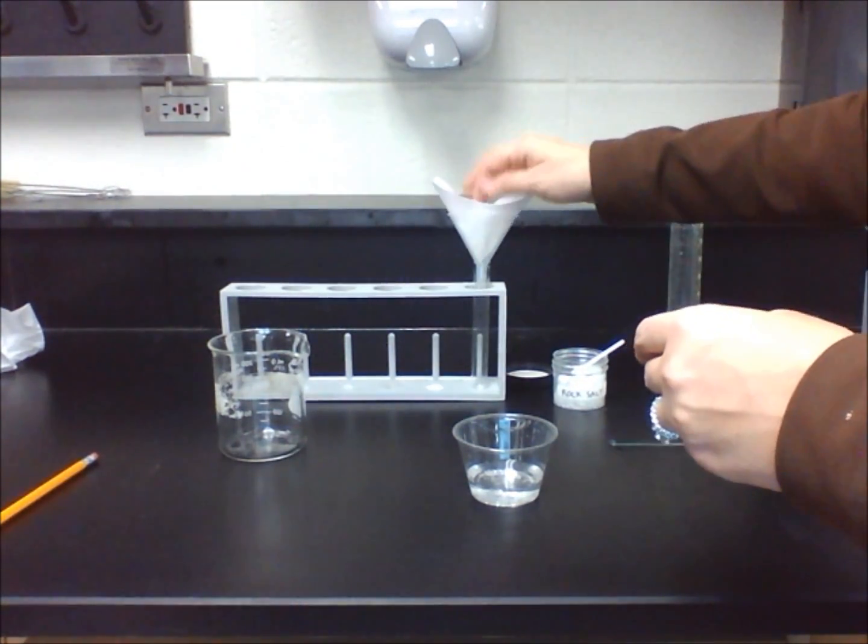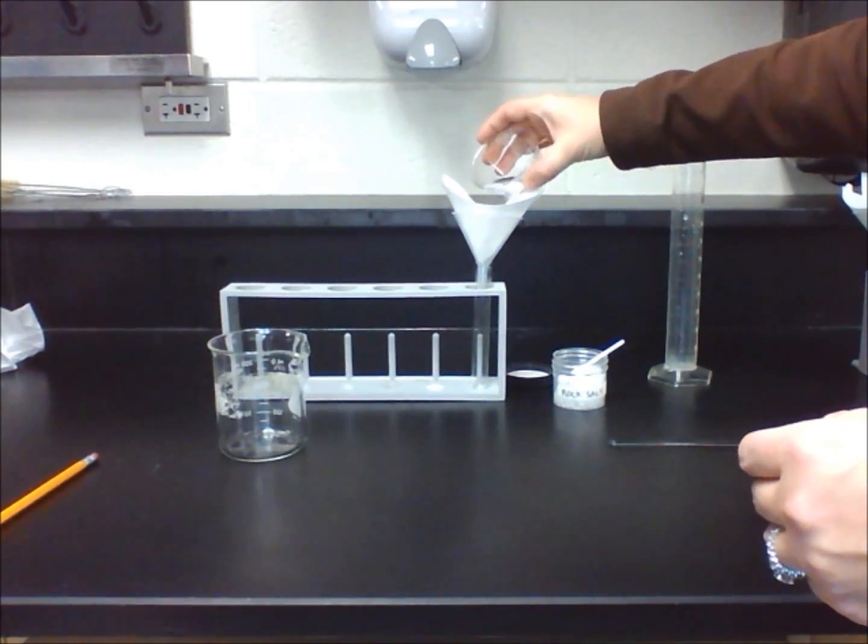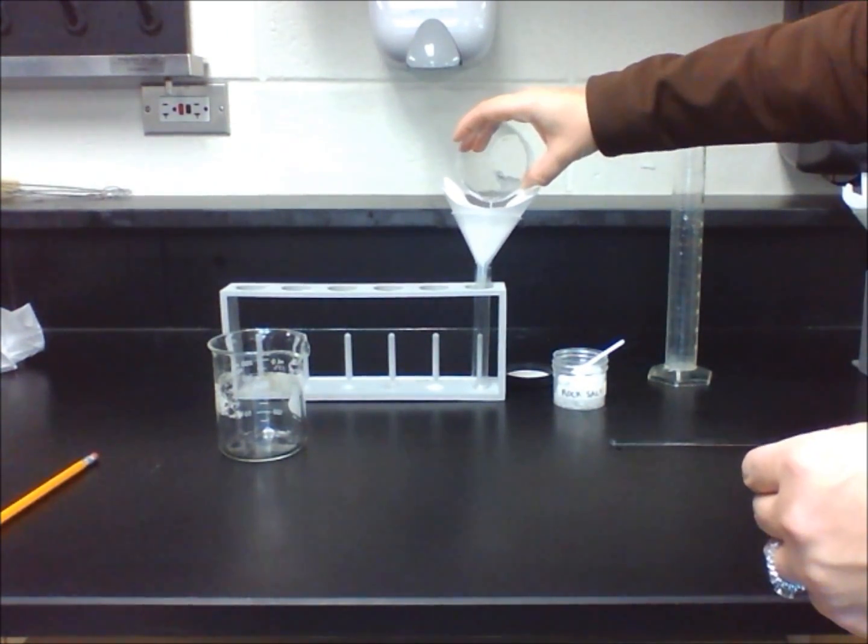Pour the rock salt solution into the funnel and wait for the mixture to filter. Record your observations.